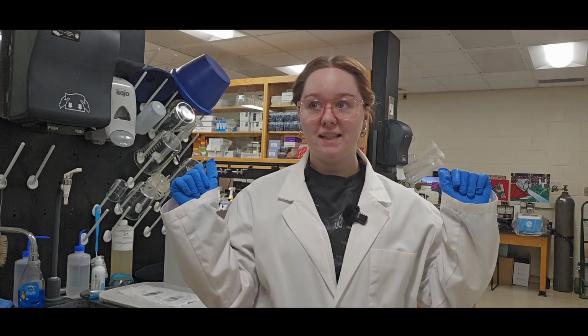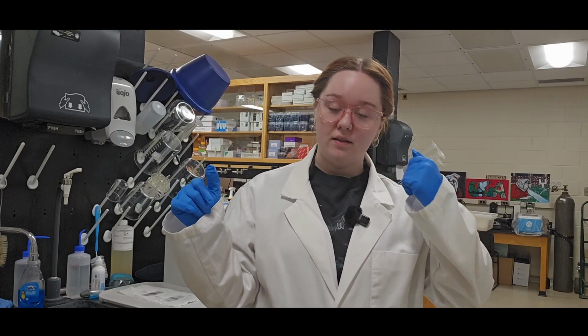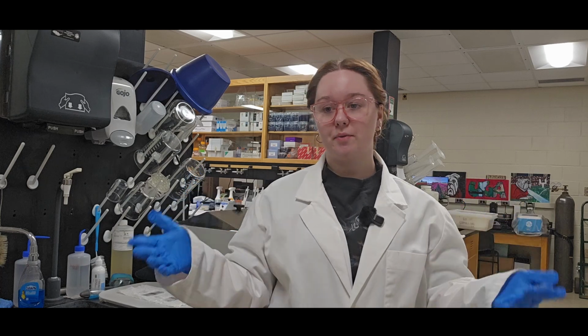Also, in recording what I've done in the lab for passaging, there are certain points where my microphone has died. Yeah, I will be doing a voiceover for those parts, just as a warning. So here I was saying to go use the bathroom, come back in, and first step, put on PPE. So that's safety goggles, gloves, and a lab coat, long pants, and closed-toed shoes.